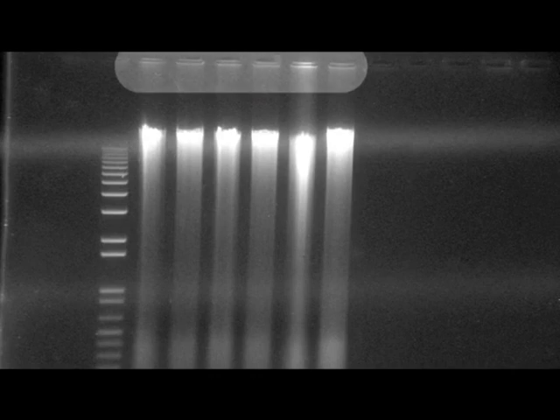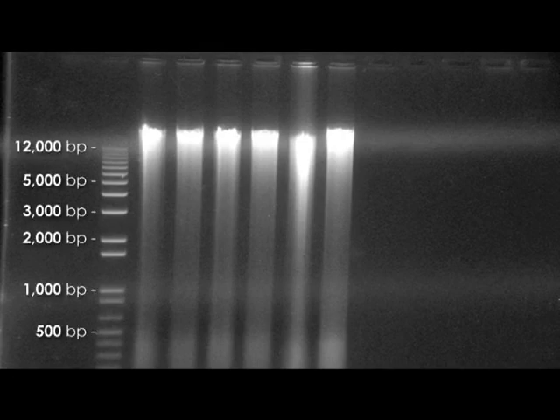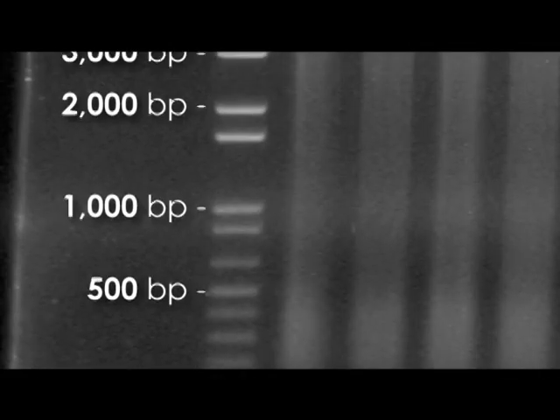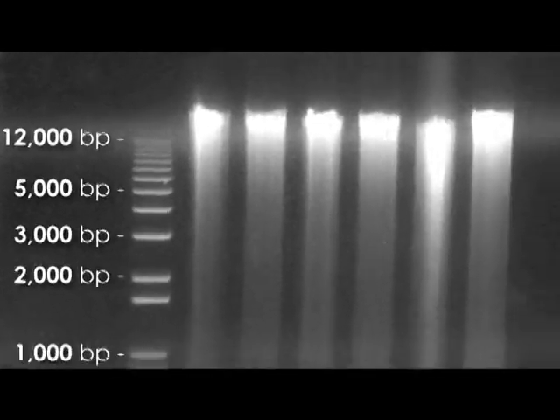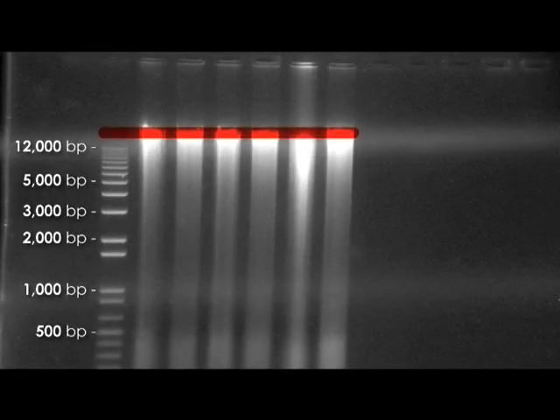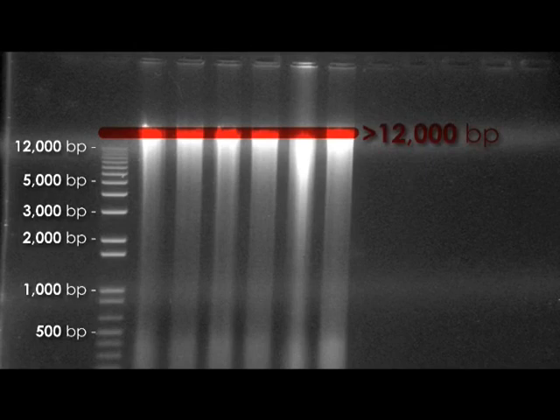We can now interpret the results of our gel electrophoresis. Across the top of the gel photo you can see the wells. Down one side, you can see the molecular weight marker, or the ladder. We know the size of each of these bands, so given that DNA fragments of the same size will migrate the same distance through the gel, we can now calculate the sizes and the masses of the bands for the DNA samples. Because the gel picture shows our genomic DNA extraction, our band is very big. Now we know our DNA extraction has worked, we can go on and amplify DNA fragments using PCR.